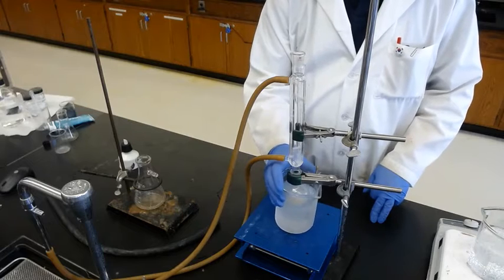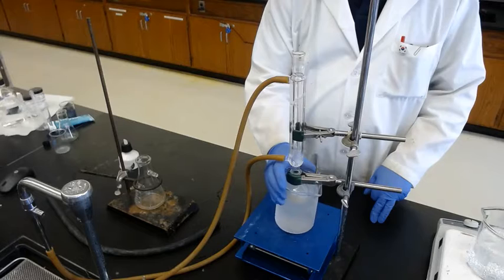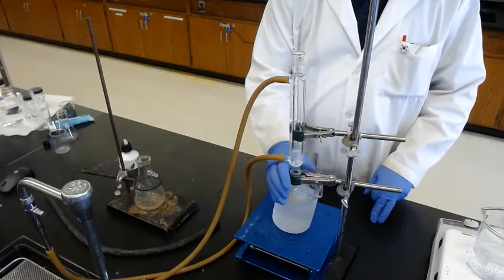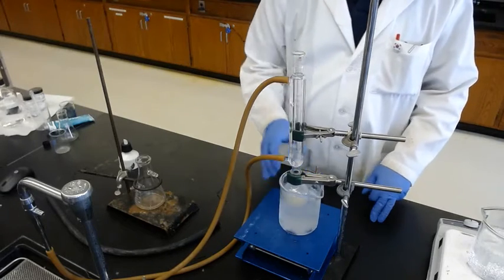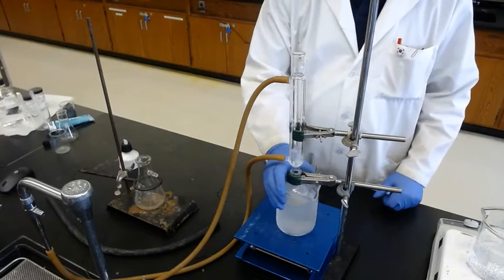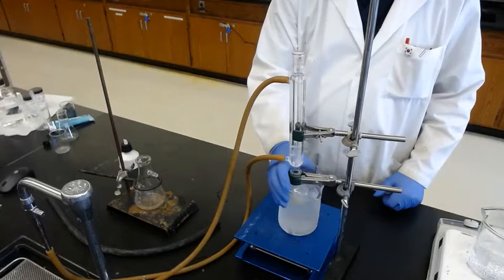So in an ice bath, which is 0 degrees Celsius, the acetic acid also freezes. So the crude product solidified, and the acetic acid also solidified. Okay. So before your filtration, you have to swirl it, just to make sure the acetic acid is not filtered.